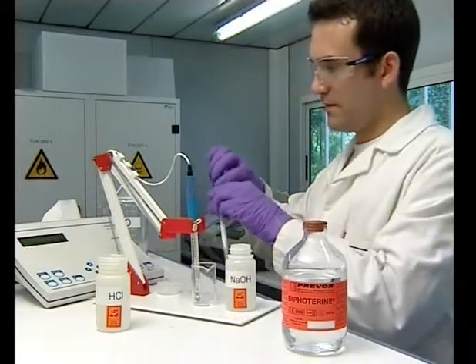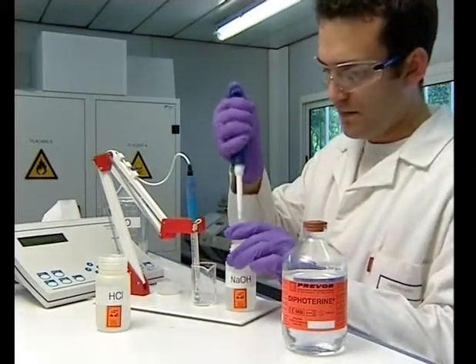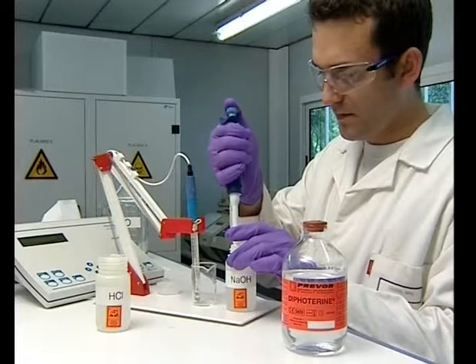The experiment uses one milliliter, which represents double the quantity that can be present in the eyes following a chemical splash.